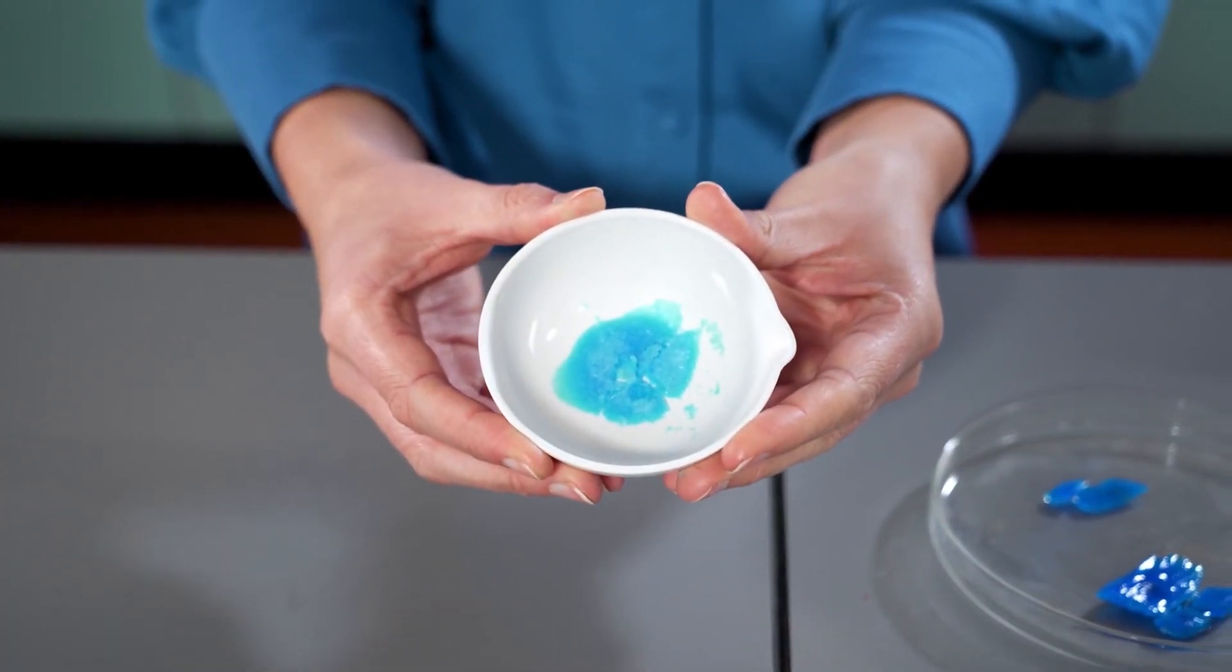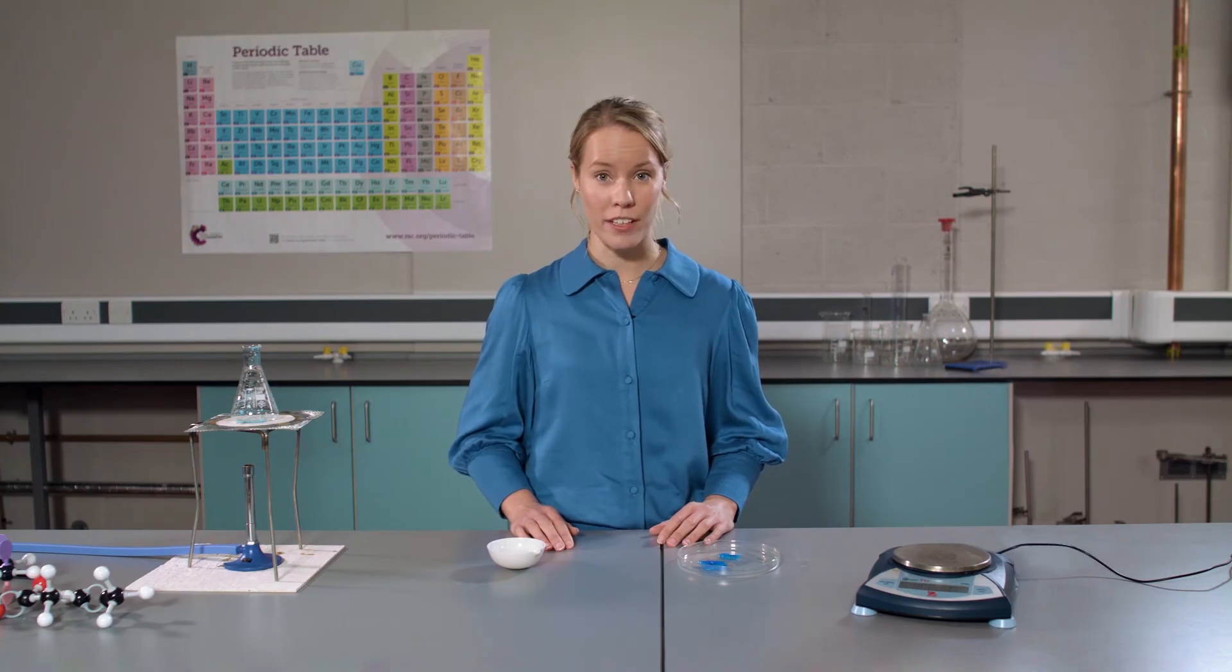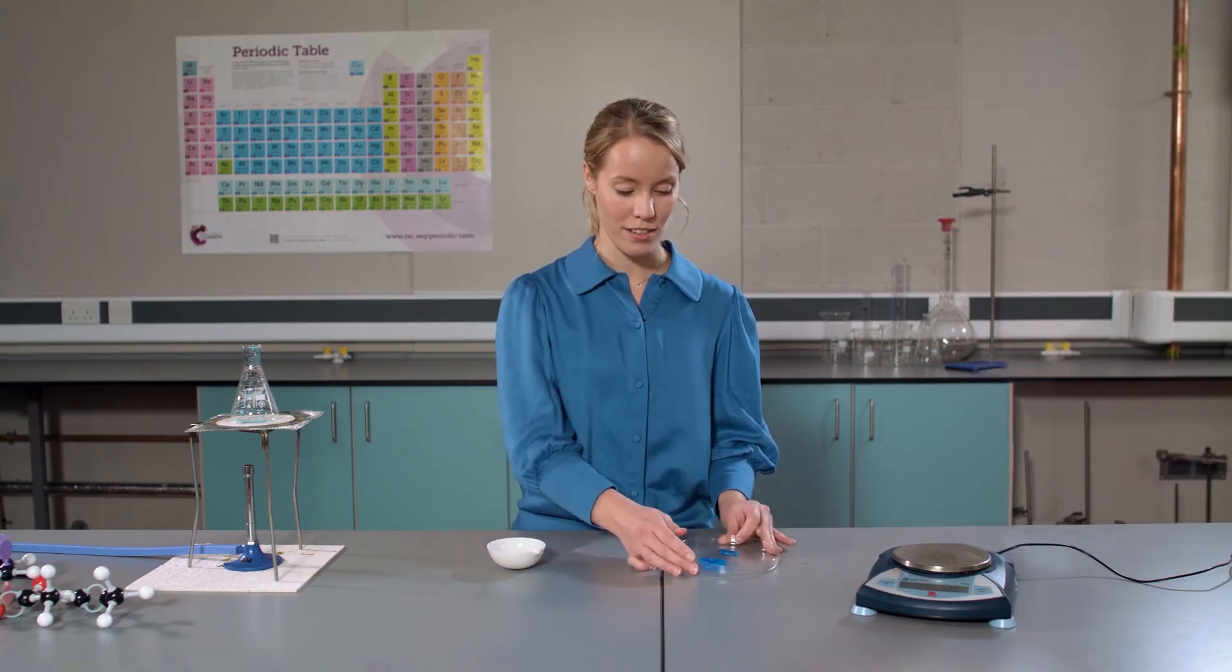As you can see, we have produced some amazing copper sulfate crystals. If you leave them to cool slowly overnight, you could even end up with crystals that look like this.